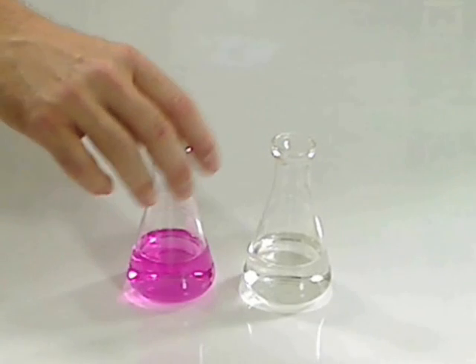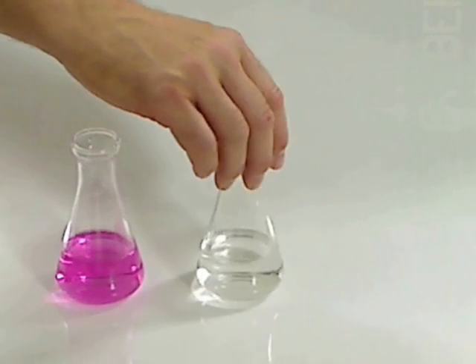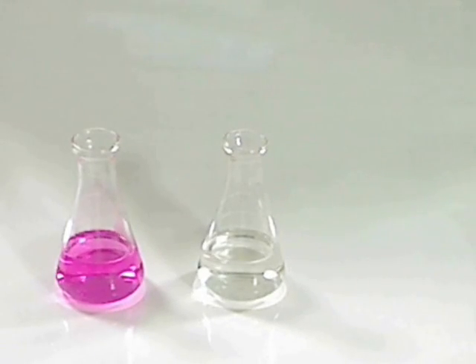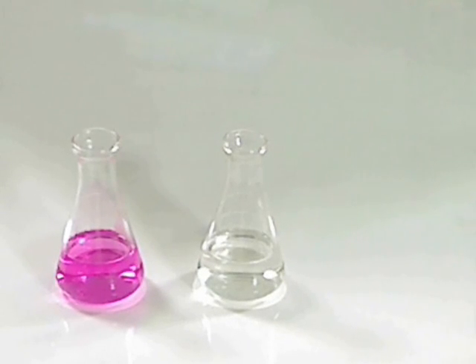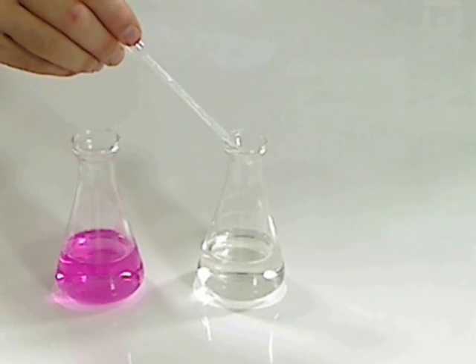What I'd like to demonstrate to you is how this would work in a titration. This currently is an acidic solution. It is colorless. I'm going to add dropwise a base solution to show you how a titration may occur.